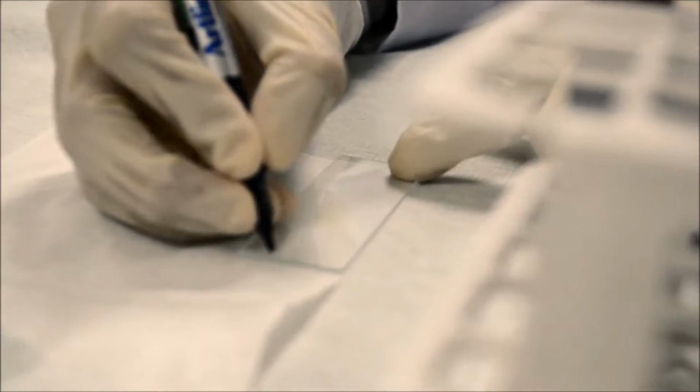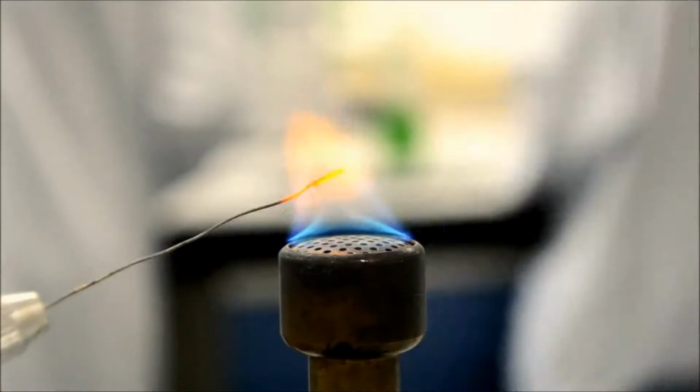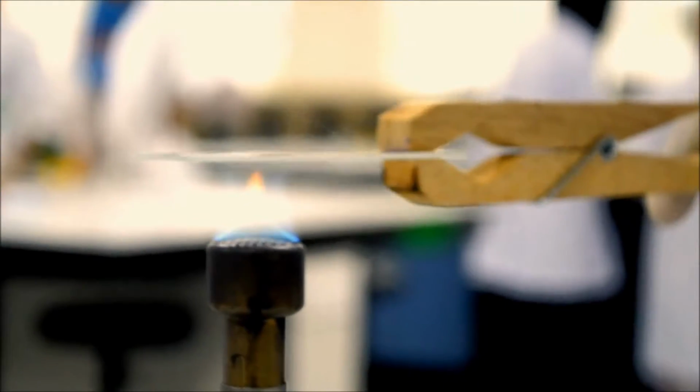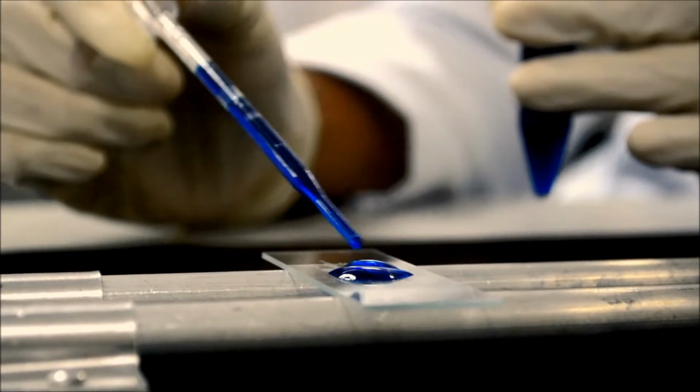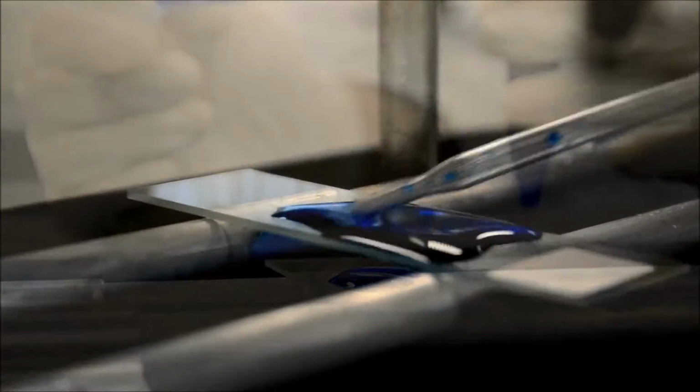We have to prepare a smear and do simple staining before we put the specimen under the microscope. Fixing kills the bacteria, inactivates the enzymes, and also enhances the adherence of bacterial cells to the microscope slide. We use methylene blue and crystal violet for different purposes. Methylene blue is used in simple staining, whereas crystal violet is used as the primary stain in Gram staining. When you are dealing with staining, time is a very crucial point, because when you give it too much time, it becomes overstained.